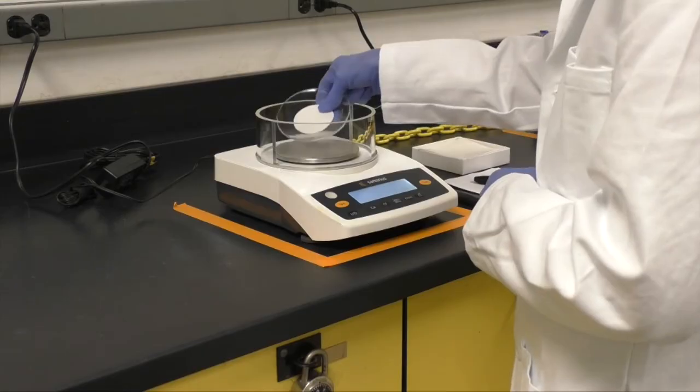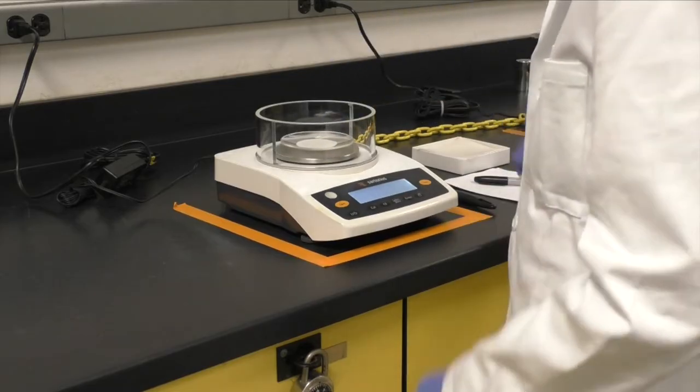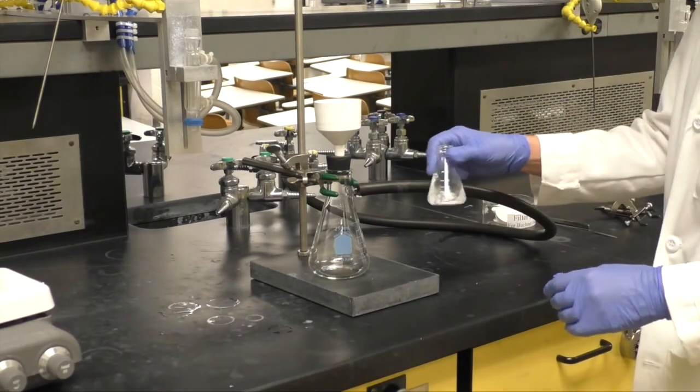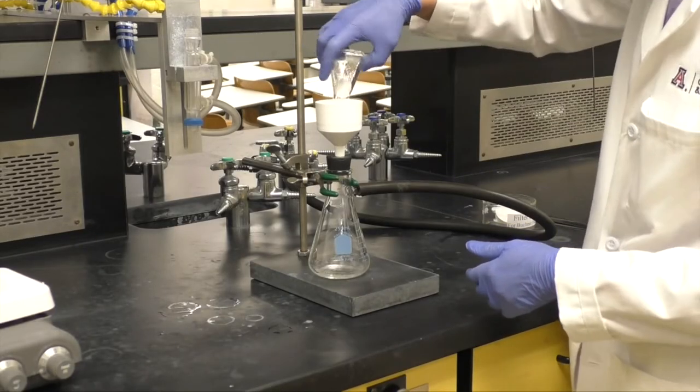Pre-weigh a piece of filter paper and watch glass. Also, set up a Buchner funnel filtration apparatus. Filter your product.